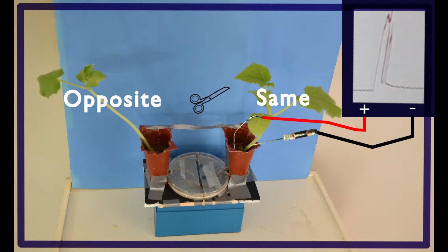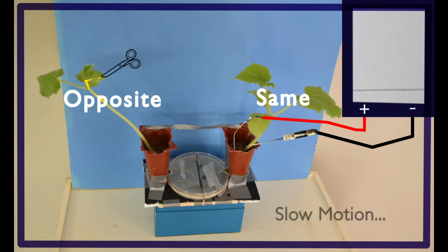When we switch to the opposite side, and the plant we're not measuring in, we would like to see no response with a leaf nudge. This would ensure us that small vibrations in the plant aren't the reason we're getting a signal. When we do a soil touch, it's okay if we see a small depolarization, as this could be expected, albeit that signal would be very weak. Lastly, what we hope to see would be a small depolarization when we snip the leaf on the opposite side. This would mean that the signal somehow traveled from where the leaf was snipped, down the axis of the plant through the stem, across both islands of agar, bridging the gap, and into the other plant that we're measuring in. This would support the hypothesis that an electrical signal from one plant could reach another plant via a mycelial pathway.